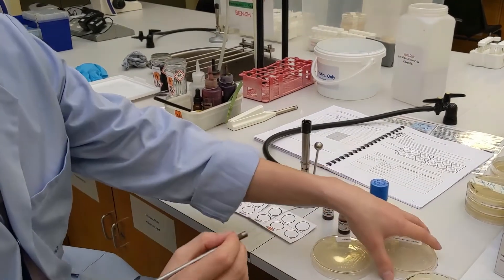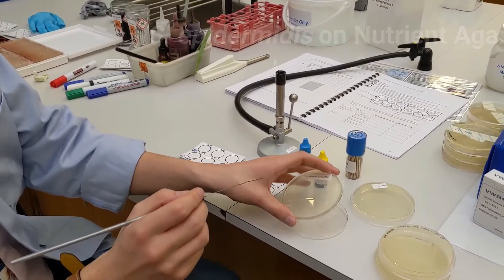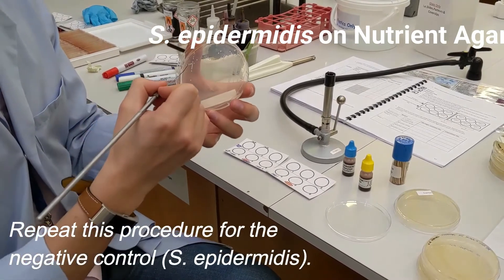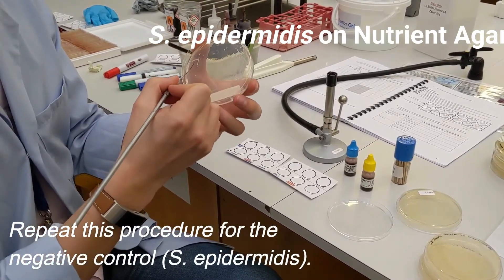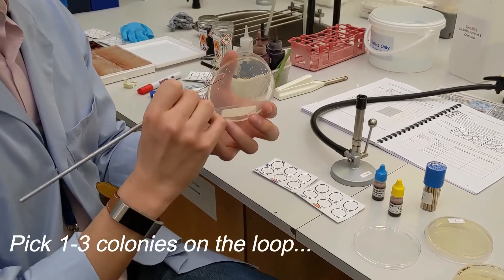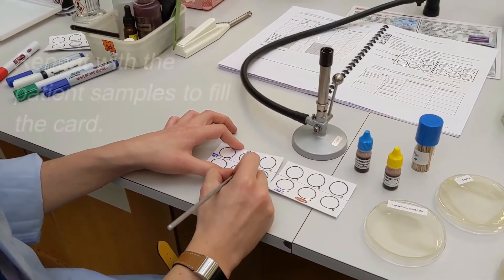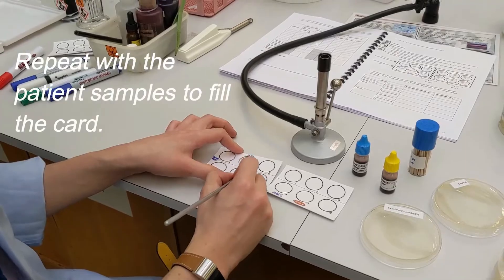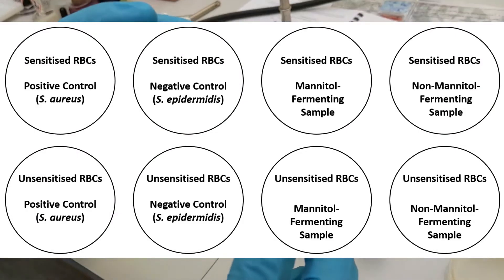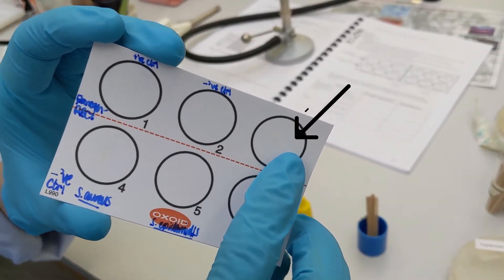Next, pick one to three colonies of the negative control, Staph epidermidis, and smear the colonies in the adjacent circles on the card. This procedure will be repeated for our mannitol fermenting and non-fermenting isolates. The bacterial smear will be a translucent off-white smudge on the card.